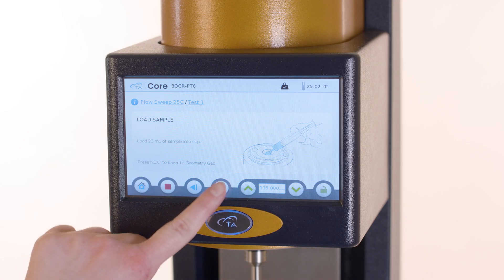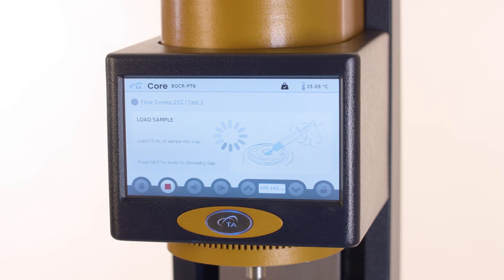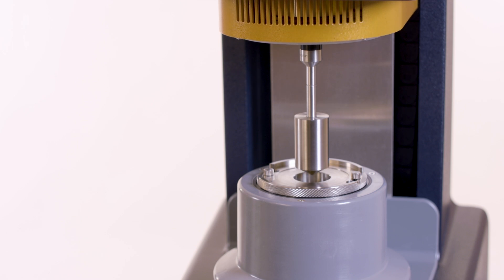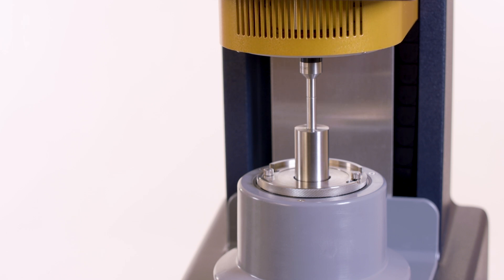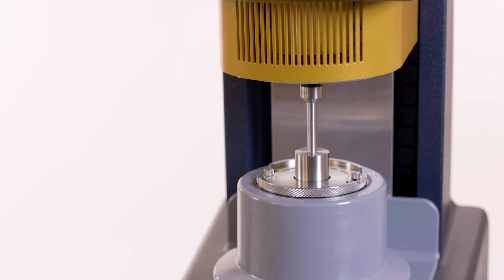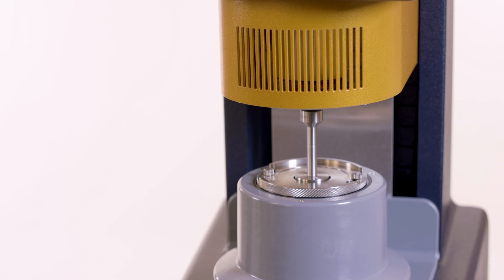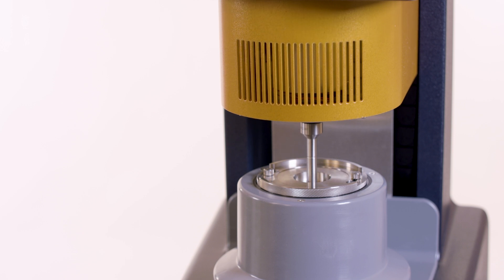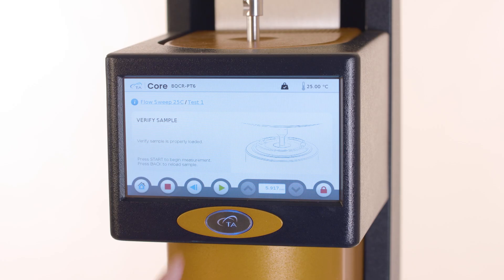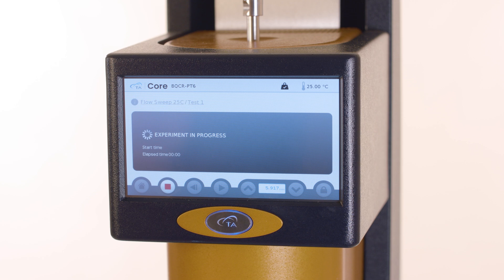Press next to lower the geometry to the geometry gap. Press next to lower the measurement position. Visually verify that the sample is loaded correctly. Press start to begin the measurement.